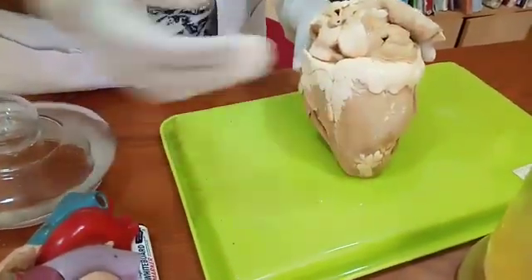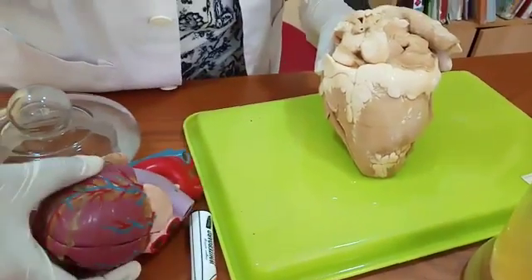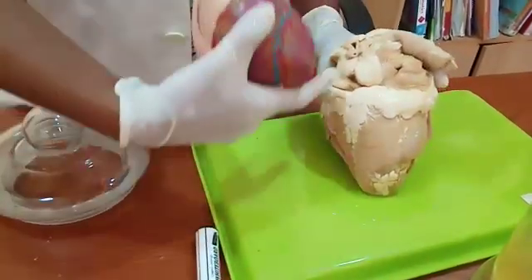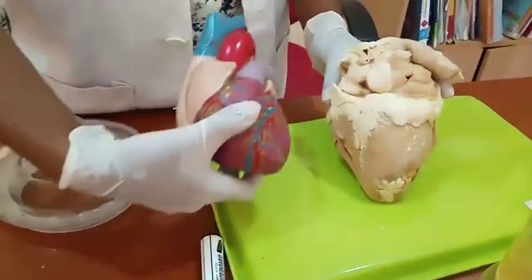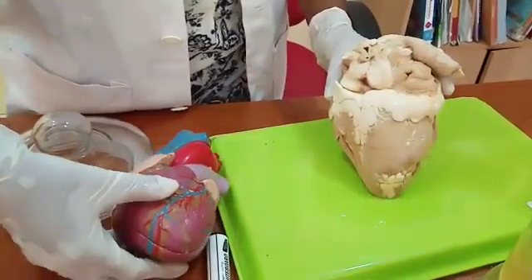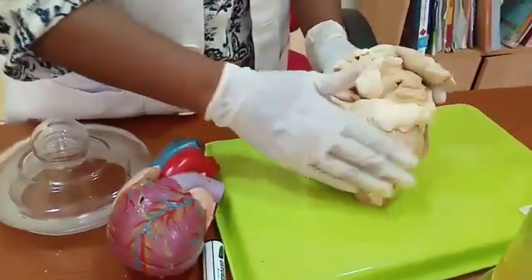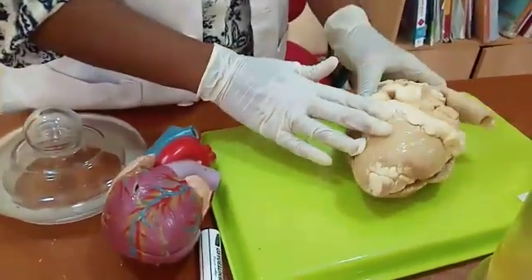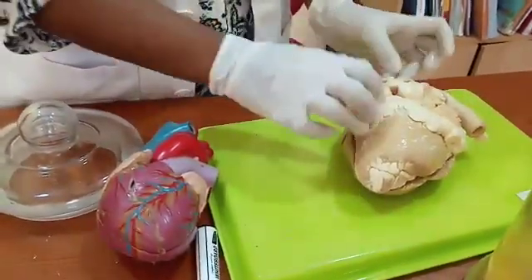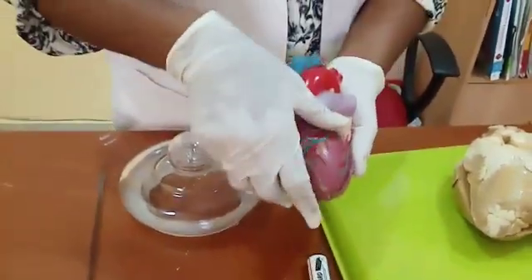This is the outer structure of the heart. As you can see, this is the model of the heart. So this is the real heart. You can compare them now, and we are going to open this heart in a minute. Before that, let me show you from the model.